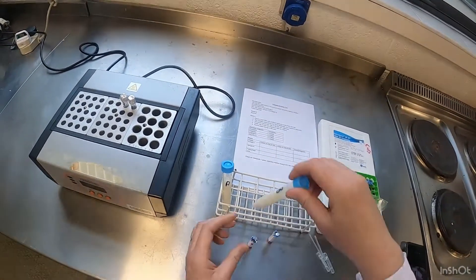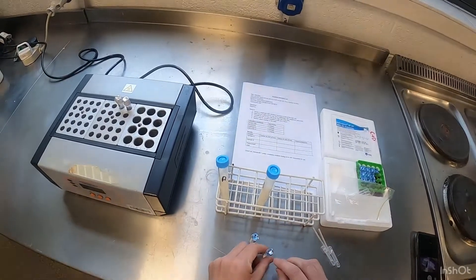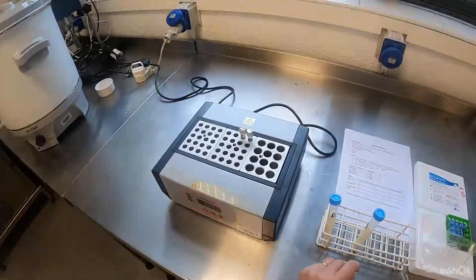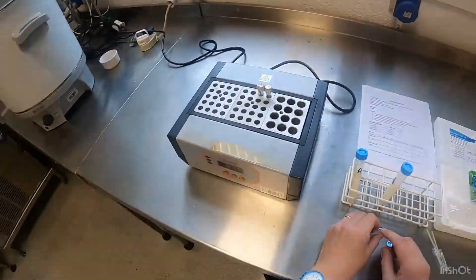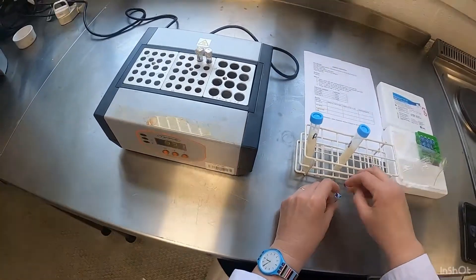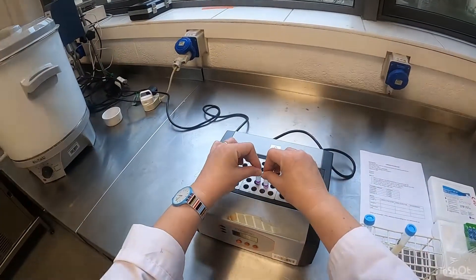Close over the lid and we're going to put it on the heating block. It does take about three hours for the bacteria to grow. You can see the heating block there, it's at 65 degrees. We'll cover it over and put them in here.